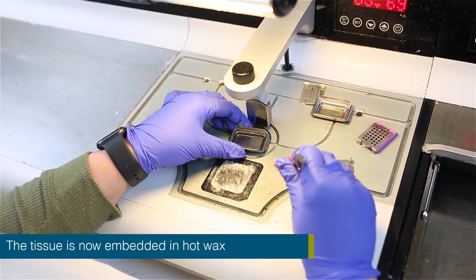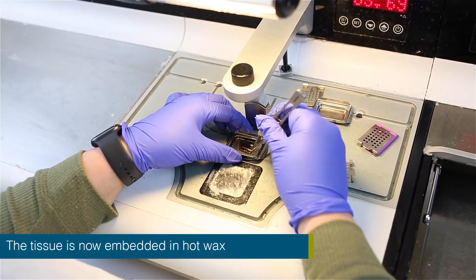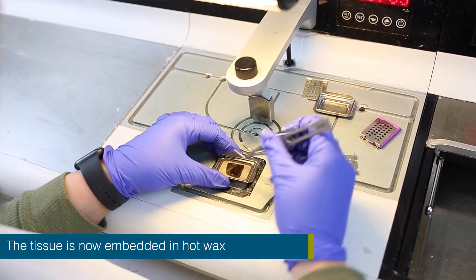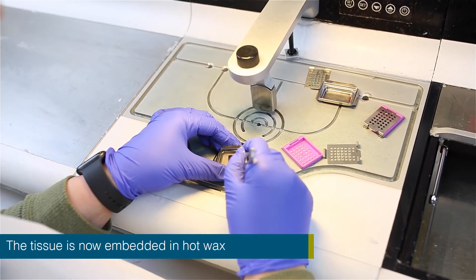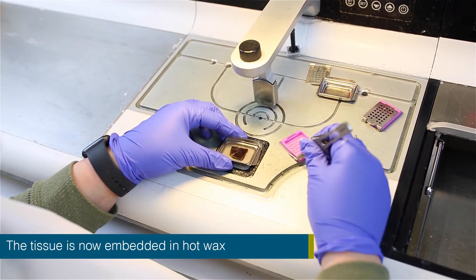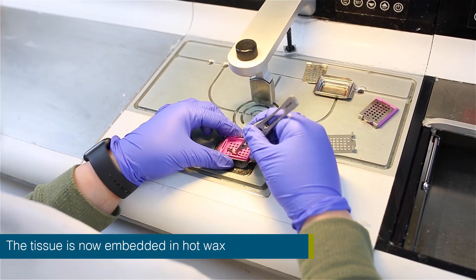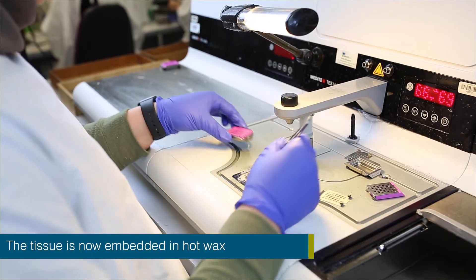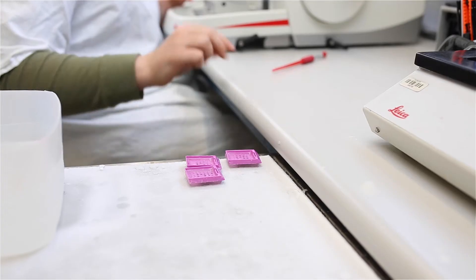The embedding stage involves removing the processed tissue from the cassette and placing it in hot paraffin wax within a mould. The mould is then placed on an ice plate to cool. Once the hot wax with the tissue within the mould is cooled, the tissue specimen is known as a tissue block and is now ready to be sectioned.